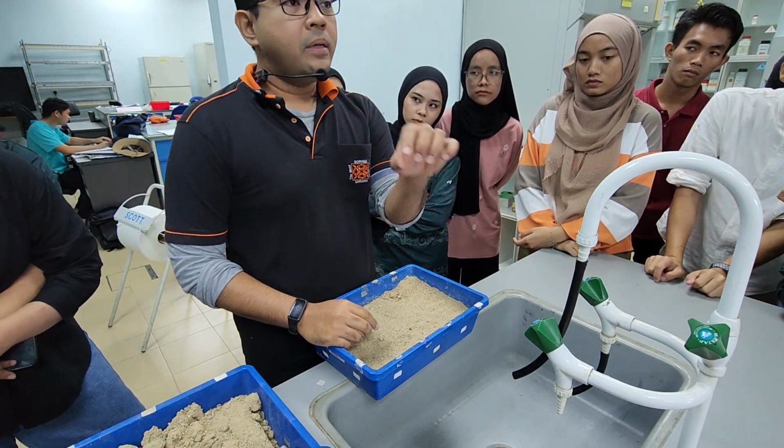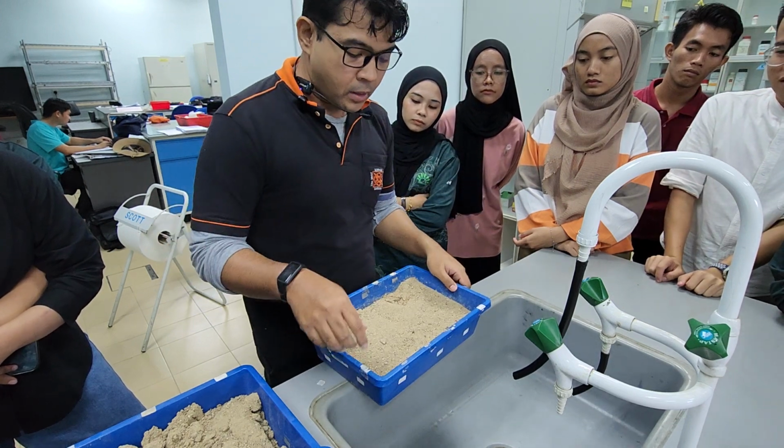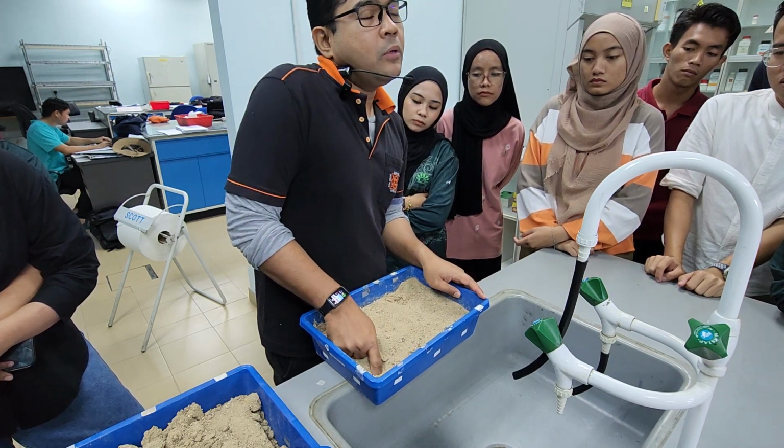Do not put the seeds straight away. You need to wetten this first. So how do you do it? I advise you to create a hole first, a well.